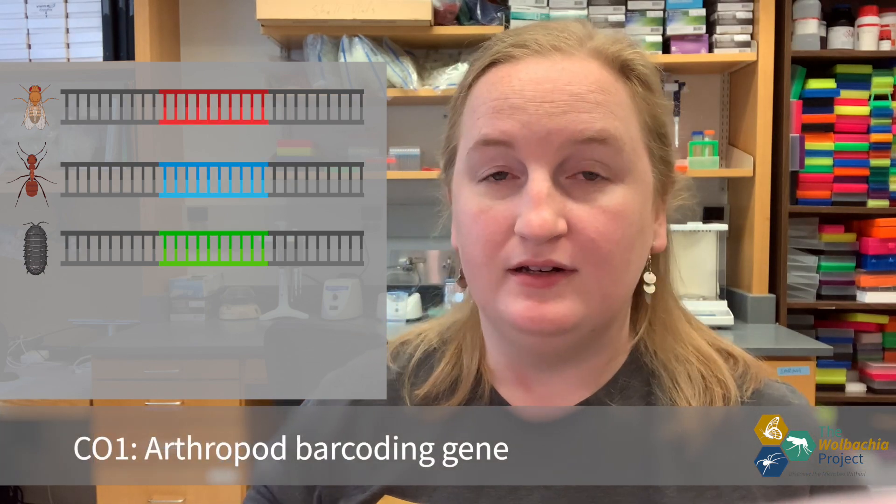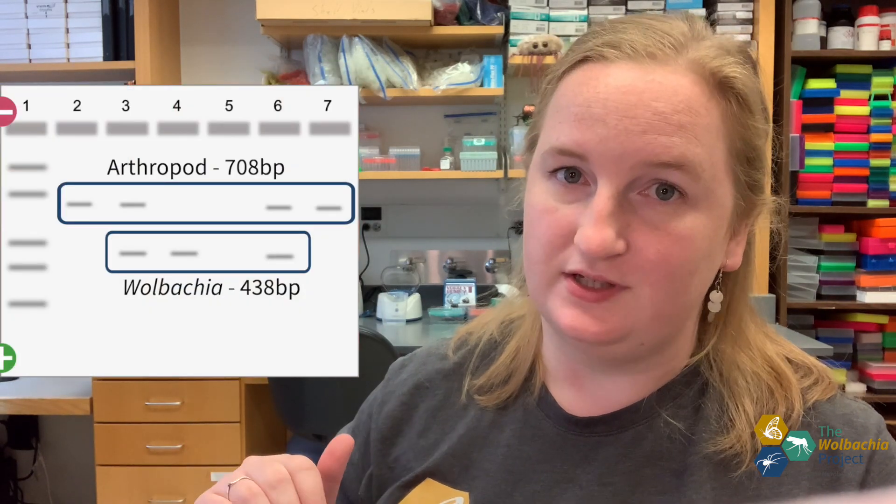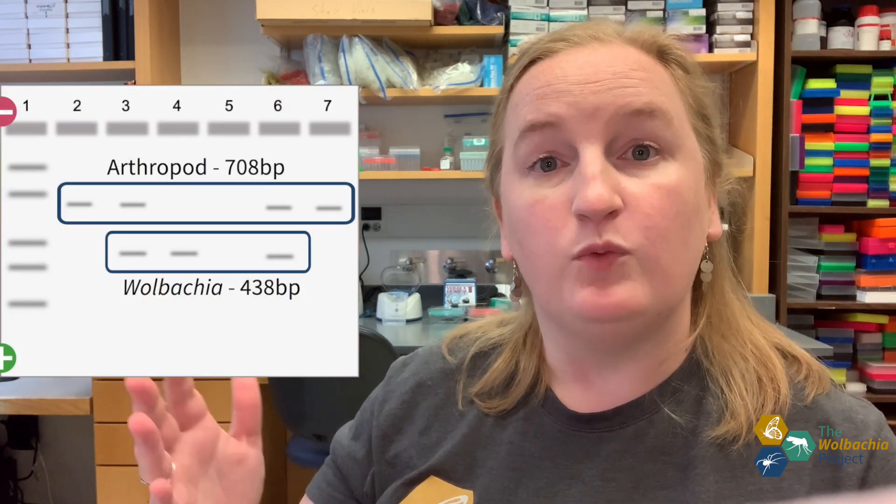Let's remember that we amplified the arthropod's barcoding region from the gene cytochrome oxidase 1, or CO1, found in the arthropod's mitochondria. We also amplified some Wolbachia DNA if Wolbachia was present. By looking at our gel, we got a qualitative result. We were able to determine if Wolbachia was present in the sample and if we were able to successfully amplify the arthropod barcoding gene.